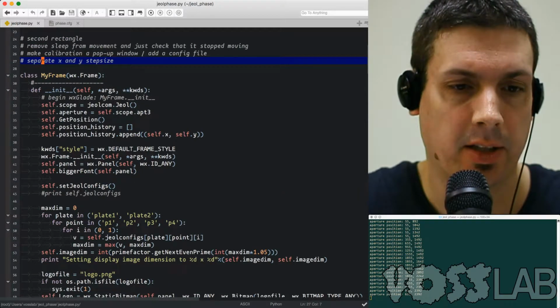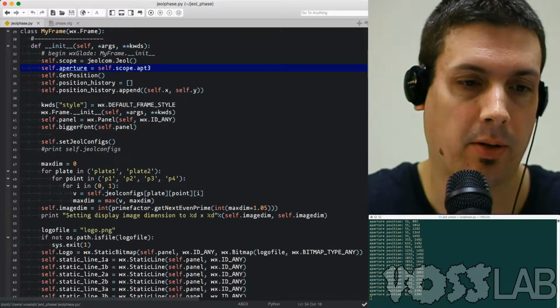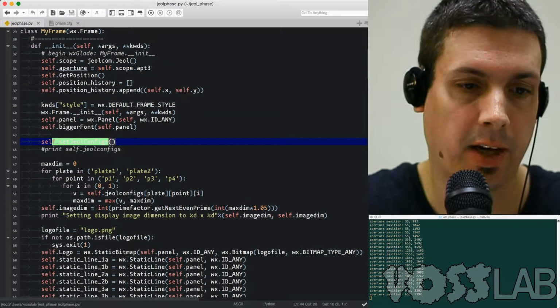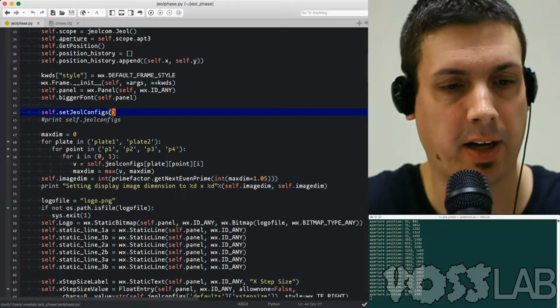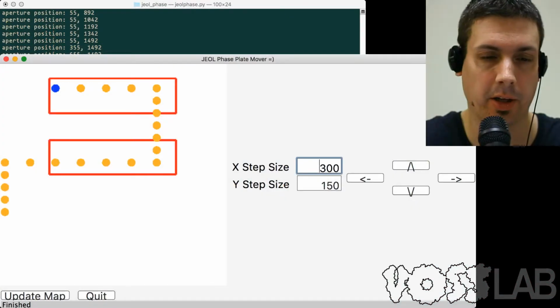So here's my standard things. We're connecting to PyScope, we're keeping track of the position history, setting up the panel, creating the font, reading the config file, then going through the config file and finding the max dimension. This is very useful if we take a look at the Python code here.